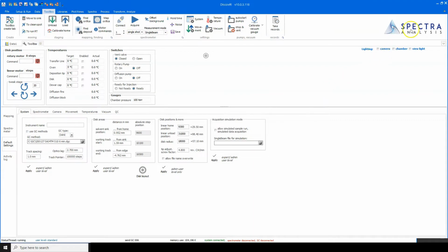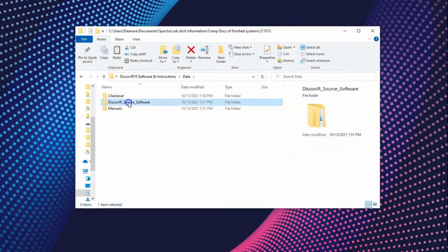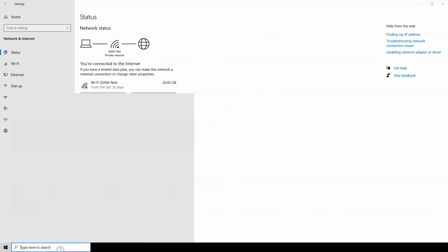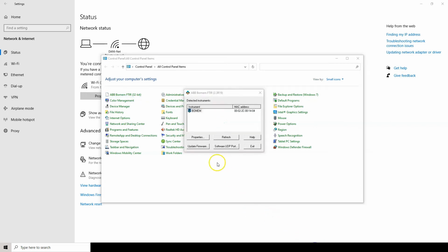To do this, close DiscovIR software and install the Bomem applet, and then perform the Bomem applet update found on the provided USB drive under Source Software. Go into the Computer Control Panel and view the icons as small. Open the ABB Bomem FTIR tab and check to see what the instrument name is. The name should be BOMEM, all capitals. Some older systems have the name as the MAC address. When moving to DiscovIR10, this should be updated to BOMEM.